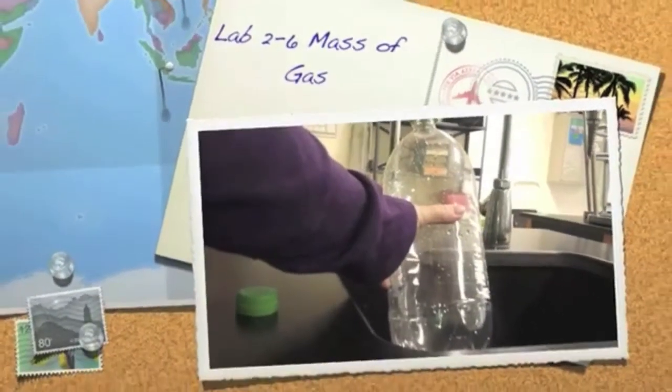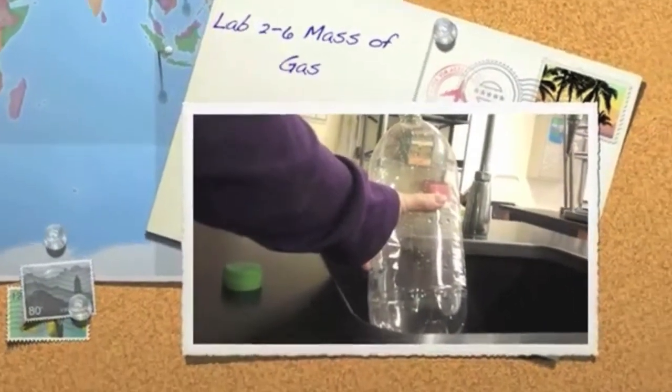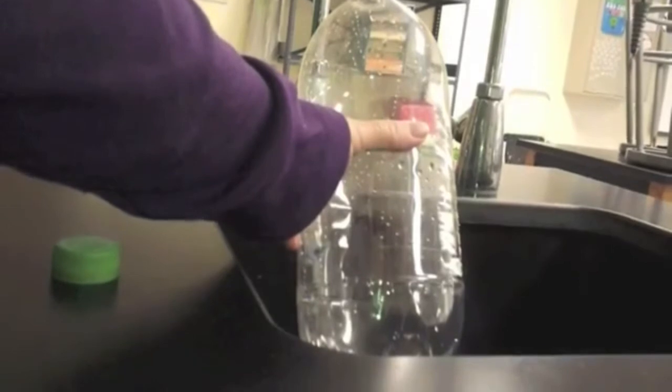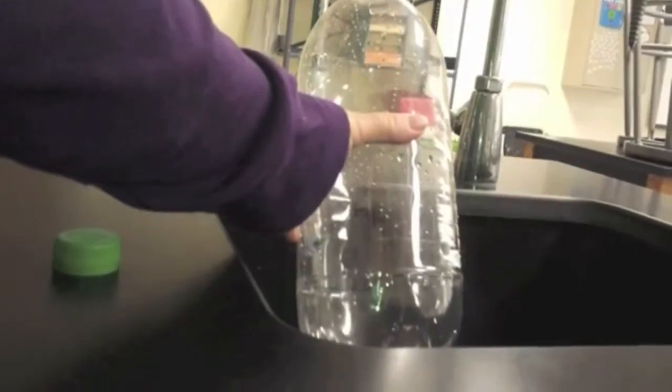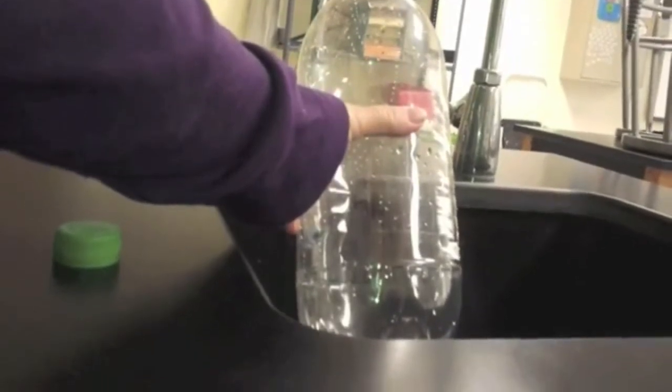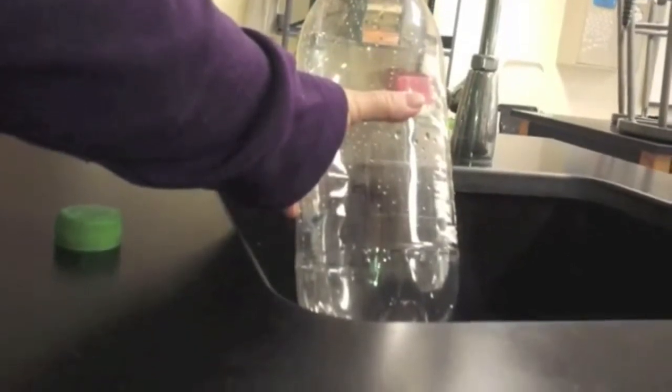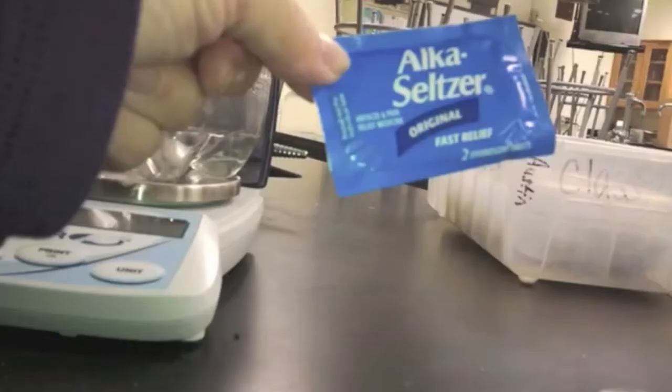The mass of gas. In this experiment, we're going to see if mass changes when we make a gas.